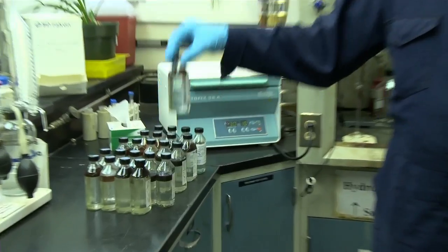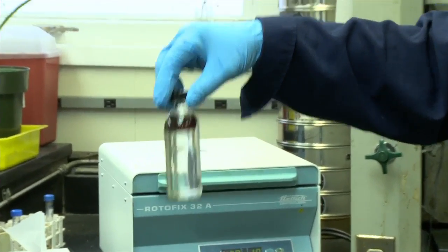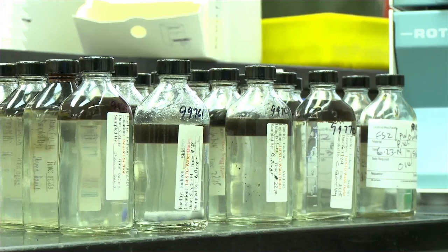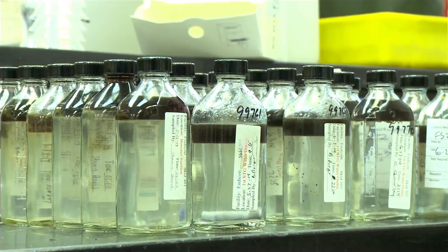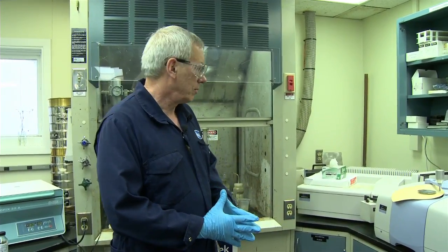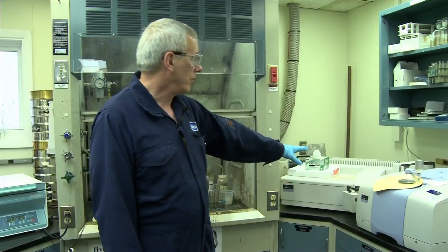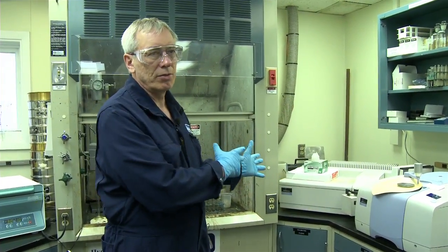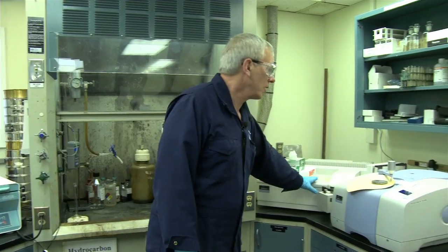And so what we end up with is something like this, which is the crude extract on top. And so we will take a portion of this and then we'll dilute it. It'll be something like apple juice, or it's a pale brown color, and we will obtain a concentration of the crude in the water. And so that's what this instrument does.